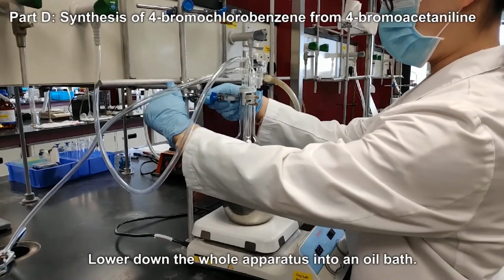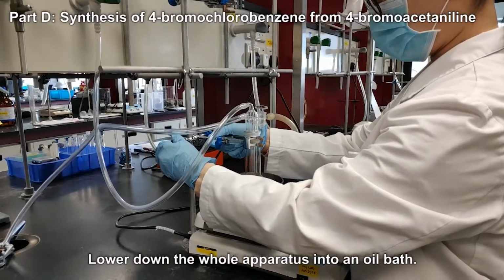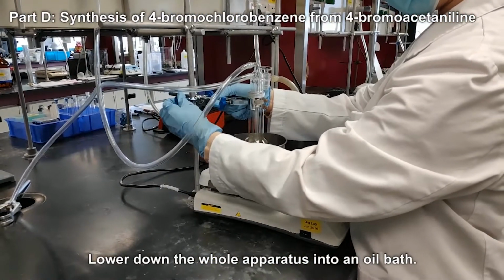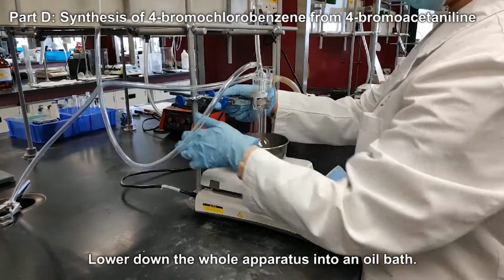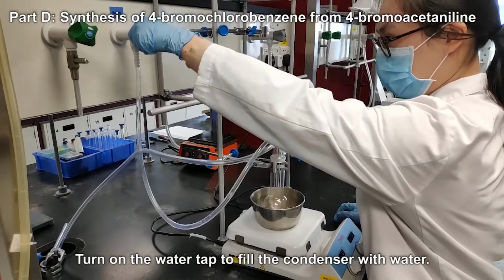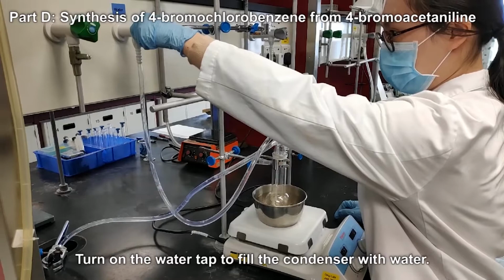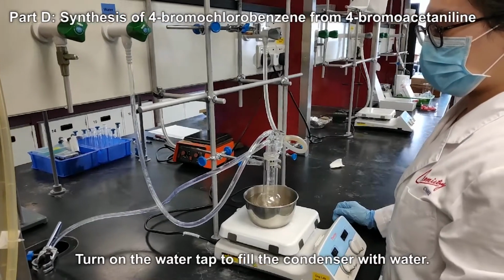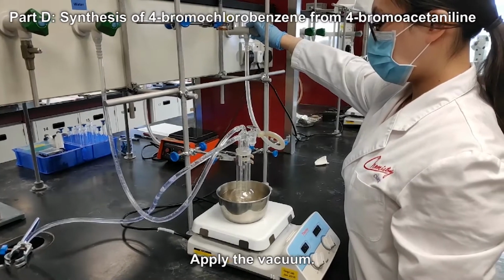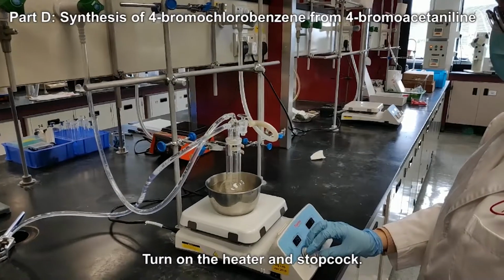Lower the whole apparatus into an oil bath. Turn on the water tap to fill the condenser with water. Apply the vacuum. Turn on the heater and stopcock.